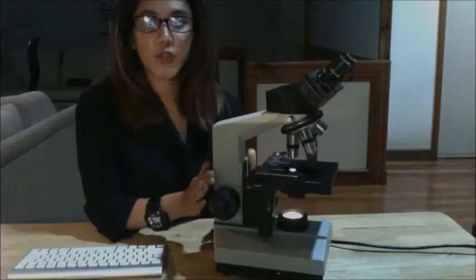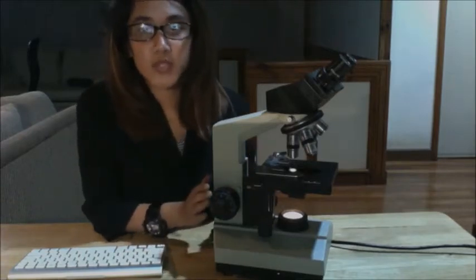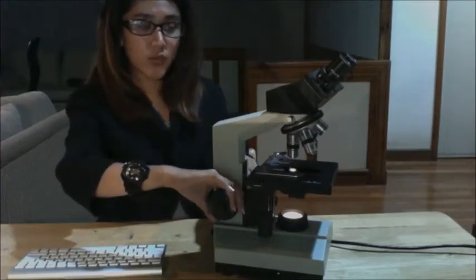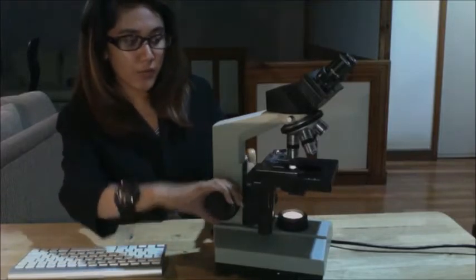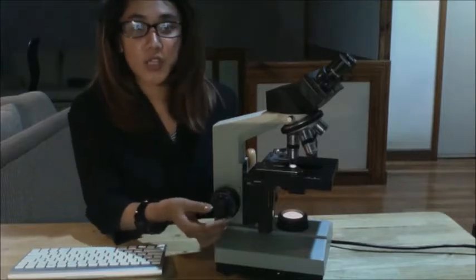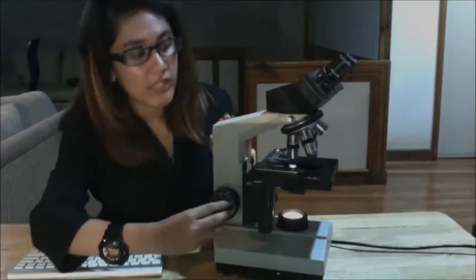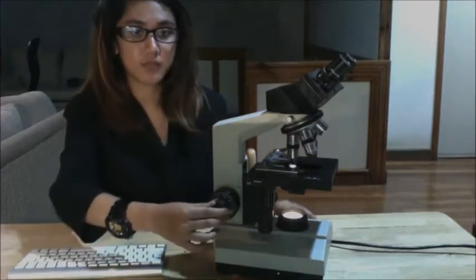Another important part of your microscope would be your focusing knobs. So you have two focusing knobs. The big one would be your coarse focus adjustment, which would move the body tube to produce large changes in your focus. So as you can see, if you would move your coarse adjustment knob, it would create very big movements of the stage. However, you would also have the small knob here, which would be your fine focus adjustment knob that would move your body tube to produce fine or small changes in your focus. Wherein if you move it, you couldn't see that your stage is moving.